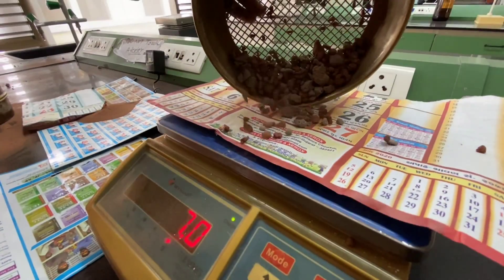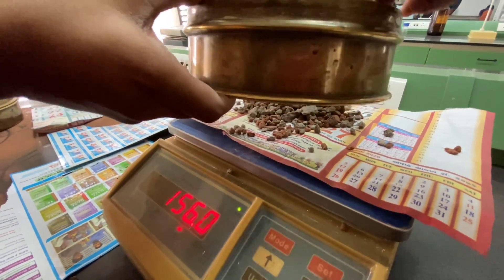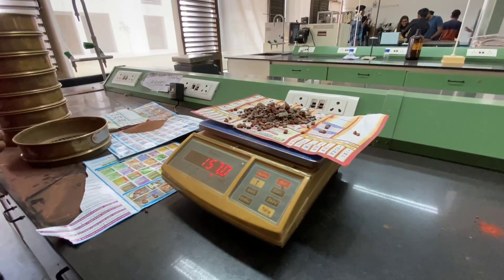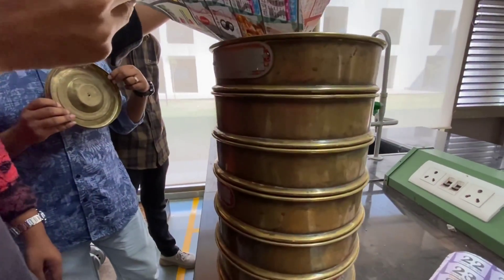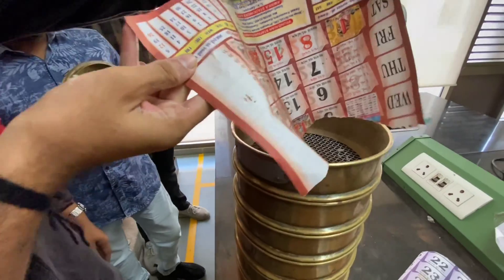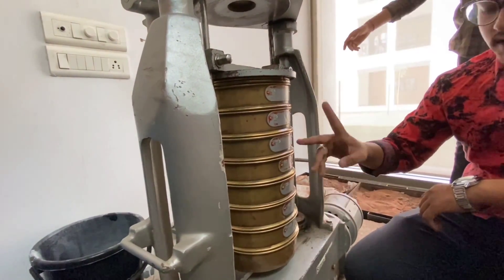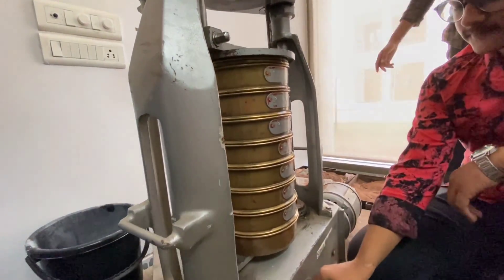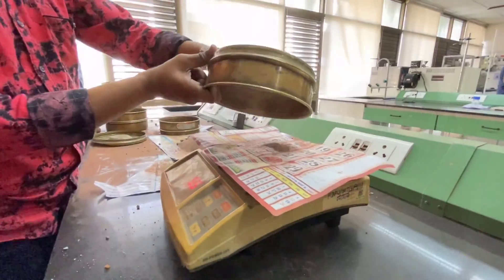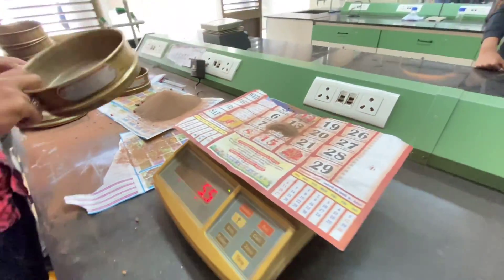Now we weigh the material retained on each screen. This is the first screen being weighed. Then the undersized particles are fed to all the screens and we shake them in the screen shaker. Now we weigh the material retained on each screen.